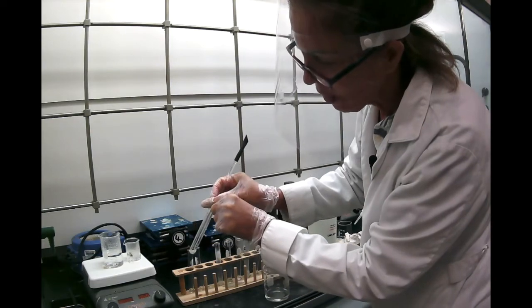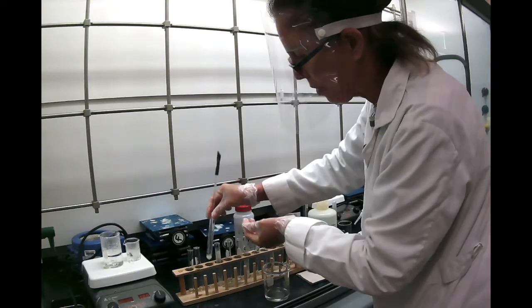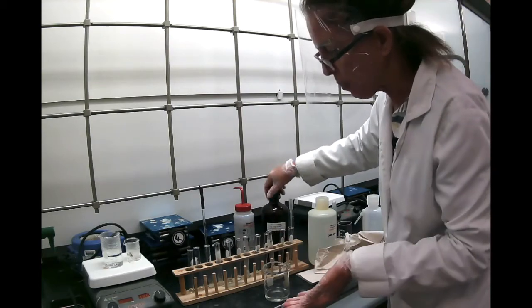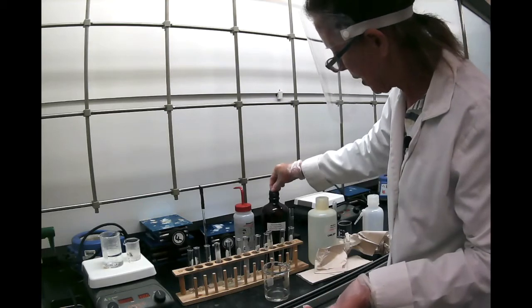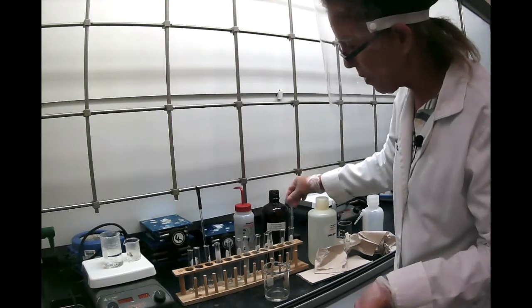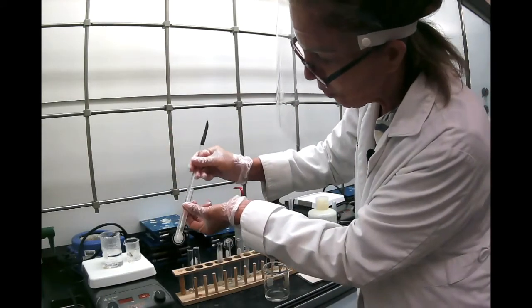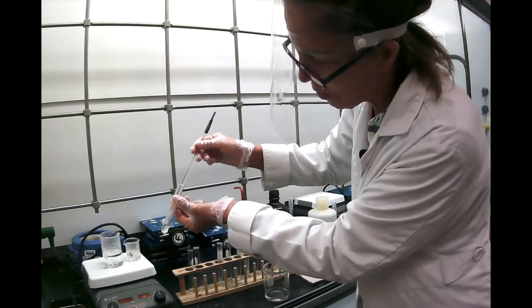So even if we put a lot, I'm going to add more petroleum ether, but the nature of resorcinol, the reason that it dissolved in water is because it's polar. It's definitely because it's polar. So because it's polar, it dissolves in polar solvents, and petroleum ether is not polar, so it's obvious that we don't expect it to dissolve. See, it's already boiling over, and it's not dissolved in petroleum ether.